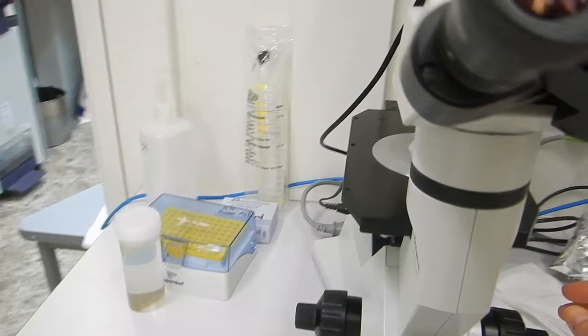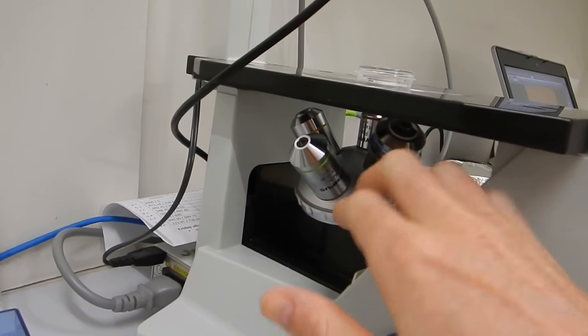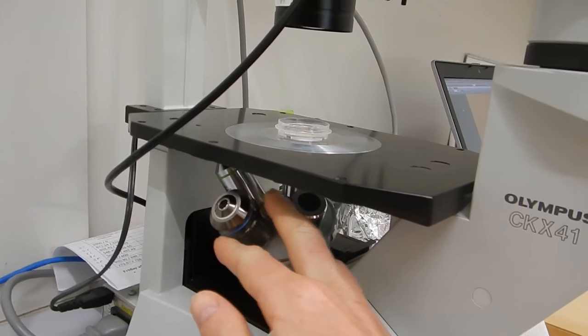But it's too far zoomed out. What I'm going to try to do is switch this—that was the 4x. Let's go to 10x.